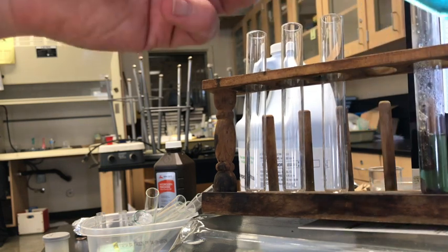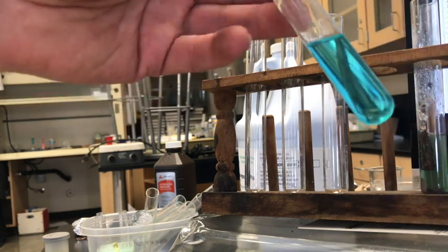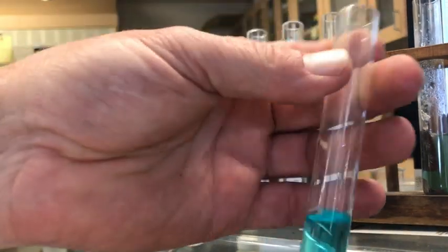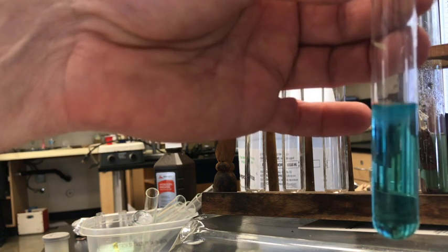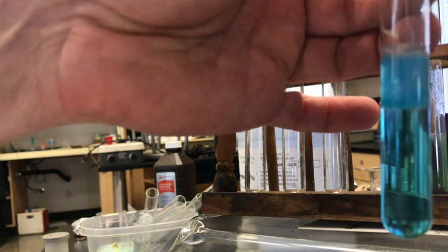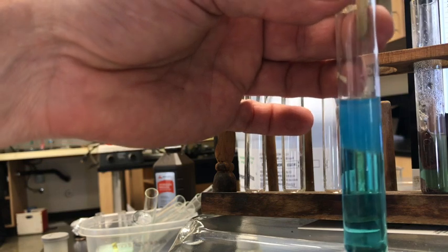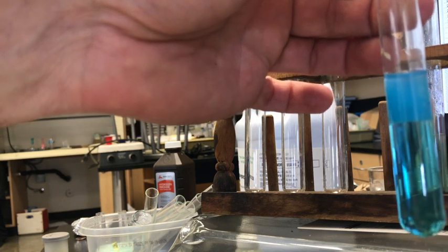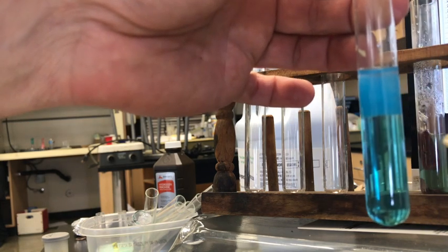And then finally, our two solutions. This is the copper chloride that I made with the acid where the temperature went up. And in reaction 3, we added the base. Just going to add some more base back in there. And look, we can see both of the reactions together. Maybe a little bit of mixing. But we had this light blue to clear solution when we added base, and then when we added the acid, it went back to this color.